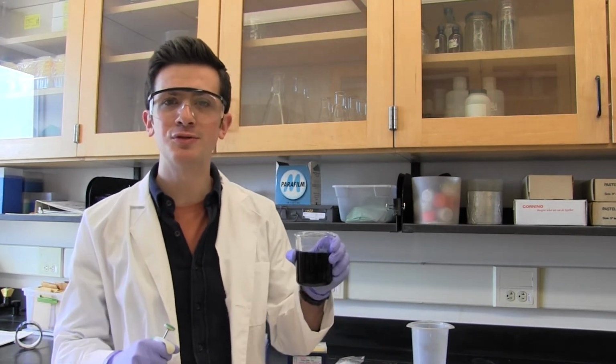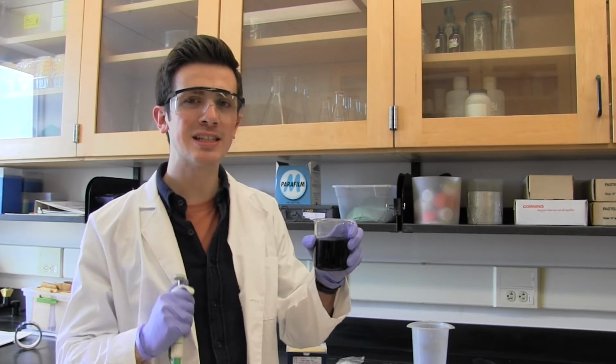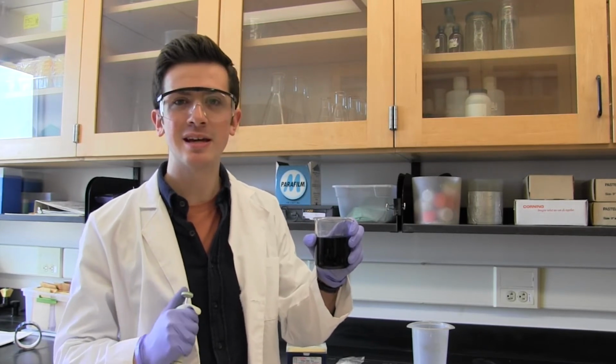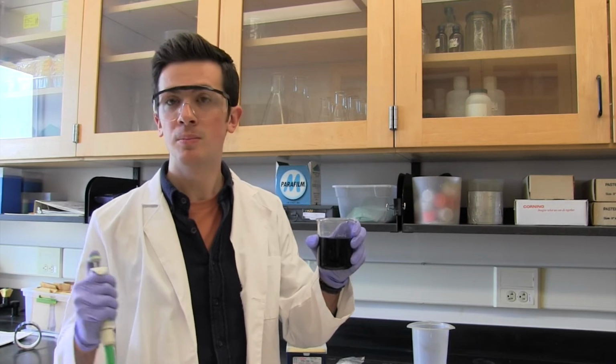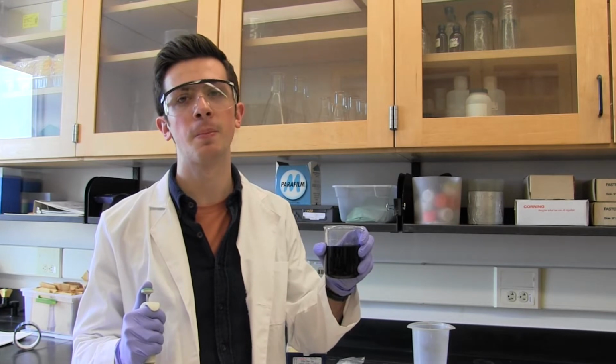I've prepared a solution for us of a mysterious blue liquid. I'm not really sure what's in it, but I think it's food coloring. Nothing else in lab is going to look like this. But you might have clear solutions, which could make things a little more difficult for you. Either way, don't hold your solution like I'm doing now. This is only for videos. Leave it on the table where it's steady and secure.